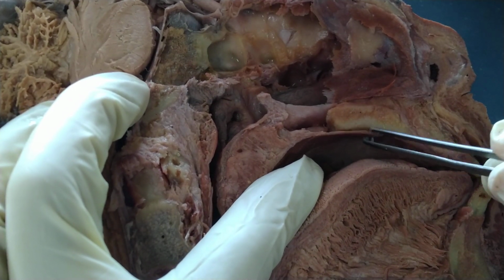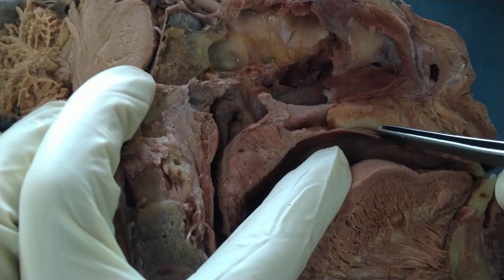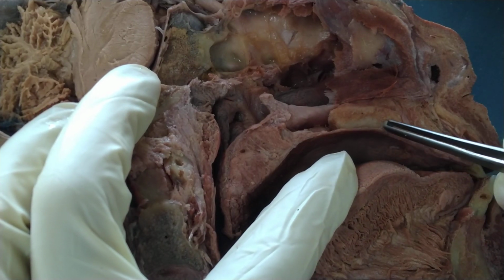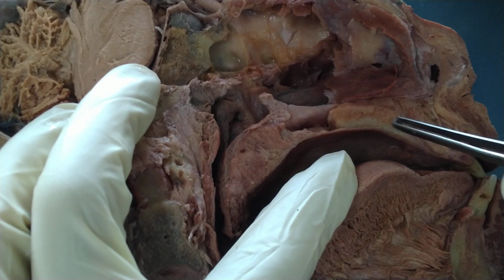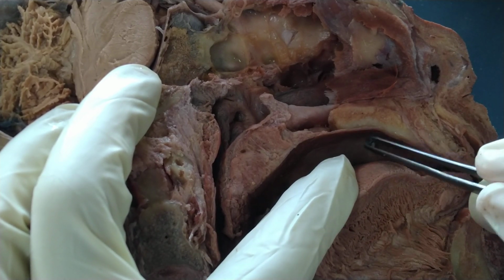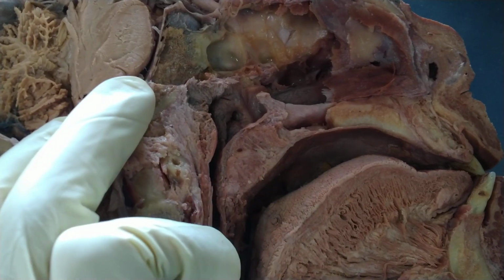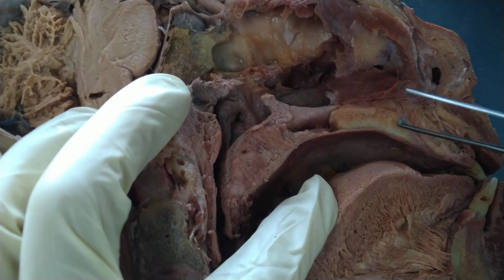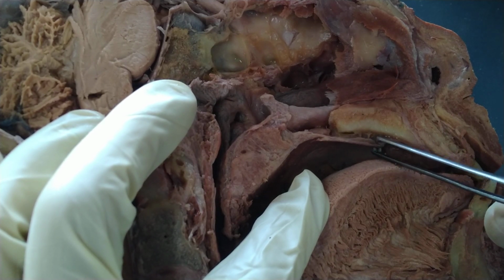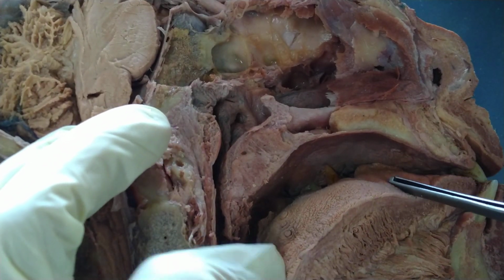So this is stratified squamous keratinizing epithelium with very scant or very little submucosa, and actually the submucosa is closely adherent to the bone of the hard palate. So that is called your orthokeratinized or parakeratinized mucosa. But for this particular specimen, it's already partly separated from the bone of the hard palate.